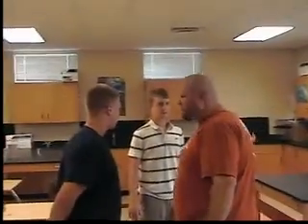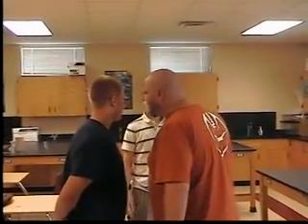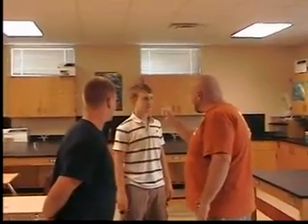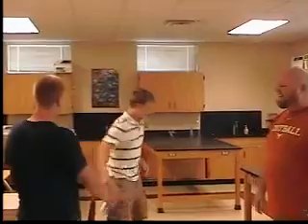Hey, what just happened to Anthony? What are y'all doing in here? Y'all doing experiments without me telling you what to do? Huh? You're not supposed to be doing experiments unless I tell you to, okay? Are you scared? Are you scared? Well, you shouldn't be. Because you're on lab safety tactics.